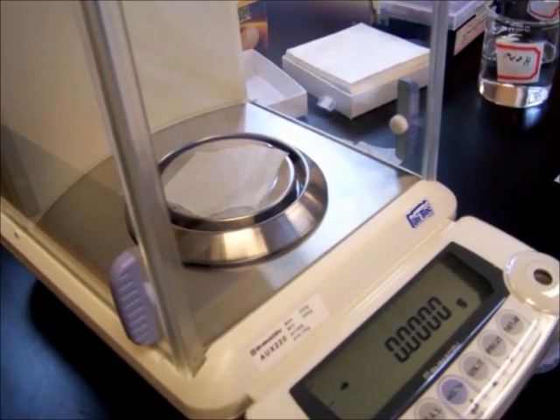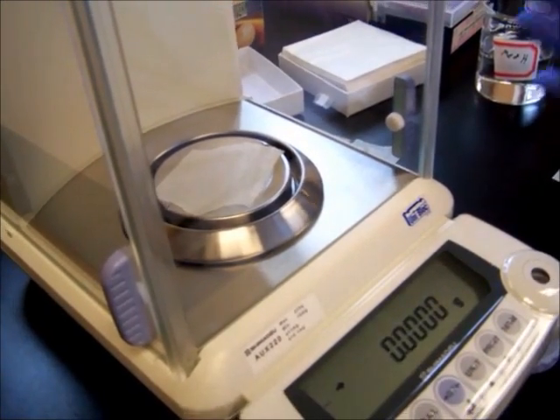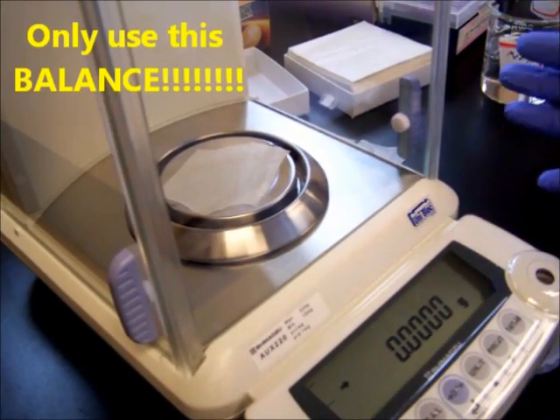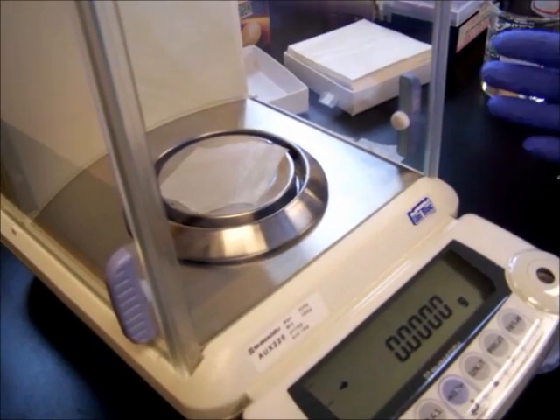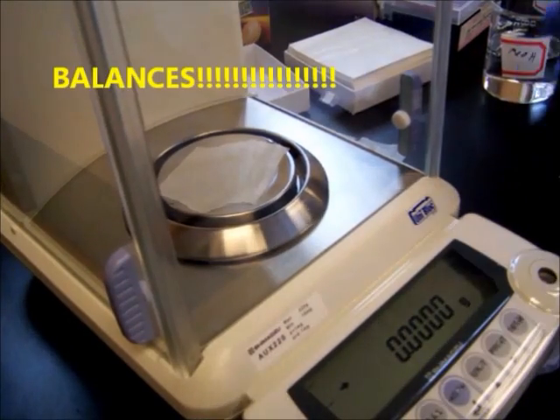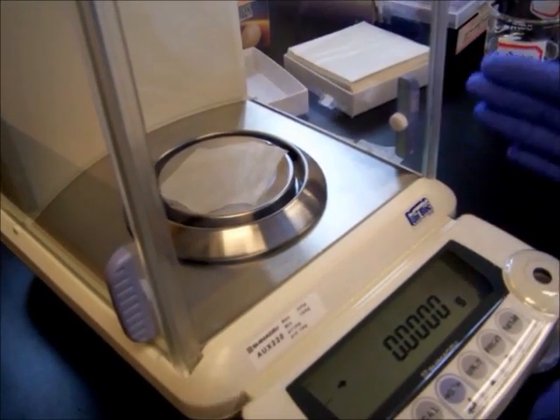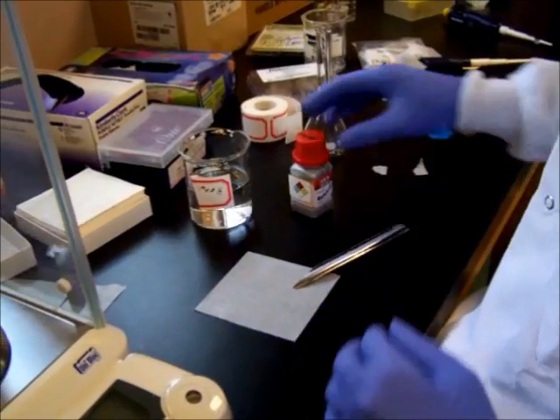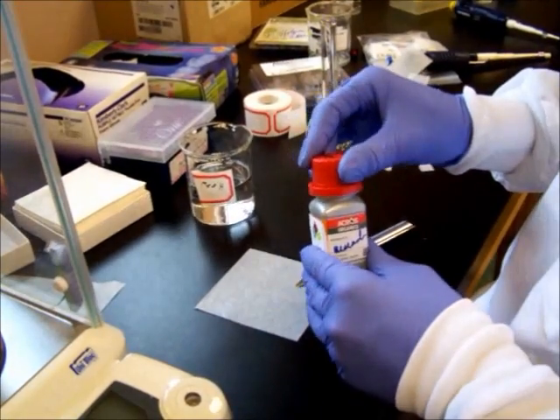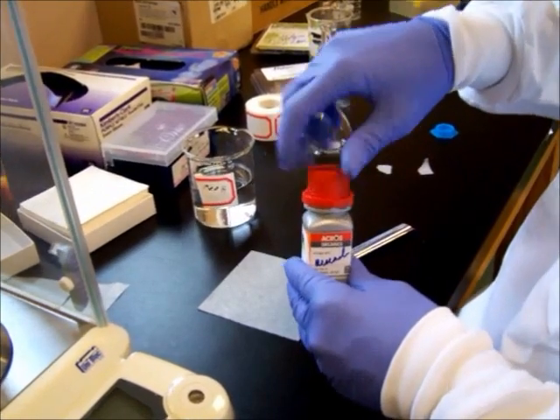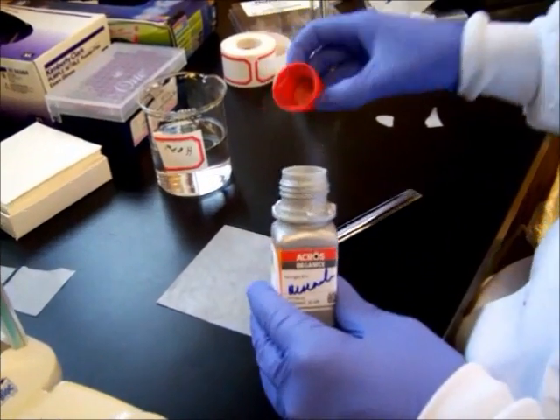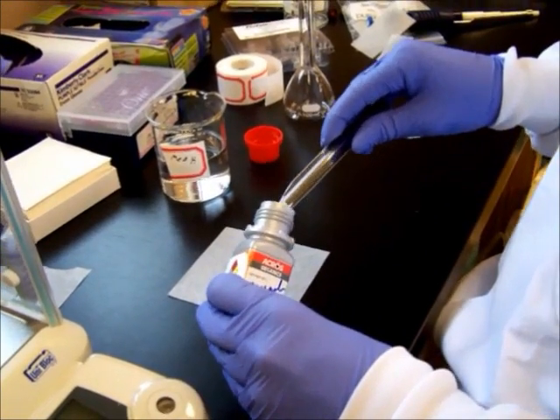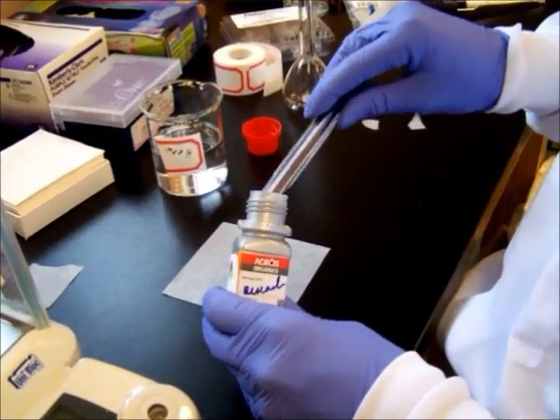Now again, when working with the LC-MS, we want to keep everything consistent, so only use this particular scale for anything that goes in the machine. That way we can keep track of how everything was measured. Don't use the scales in the other room, only use this particular scale. Okay, come over here. Open our Naringin.